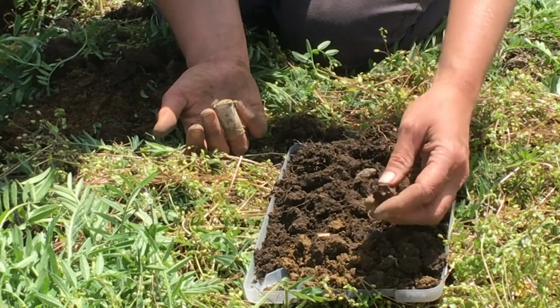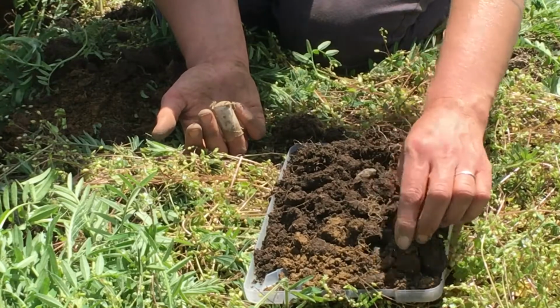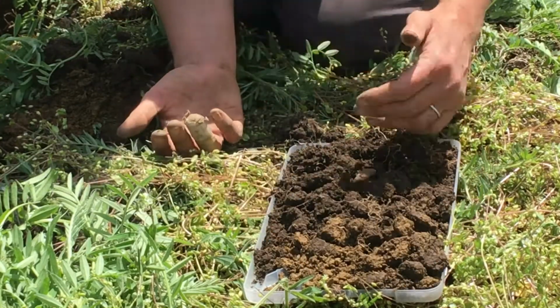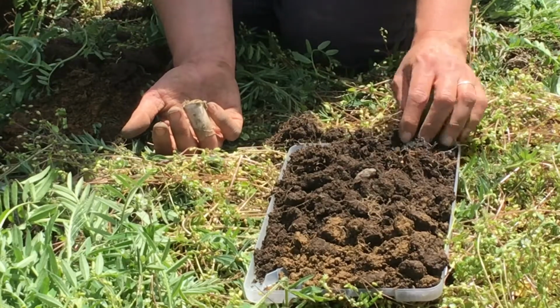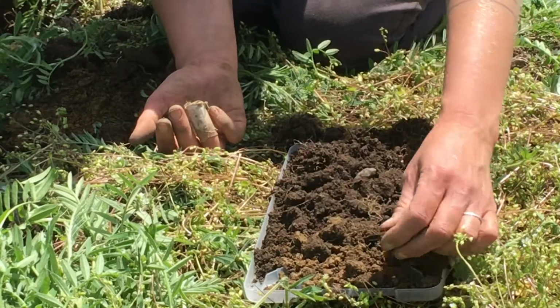But as we head down into the soil profile, we're looking at a weaker aggregation, blockier. Up here we have granular and strong prevalence, and as we go down, we're finding weaker prevalence and blockier structure.